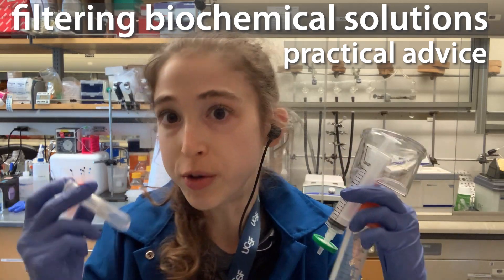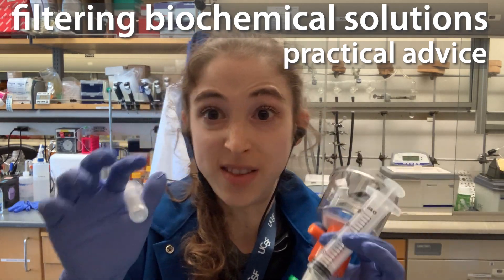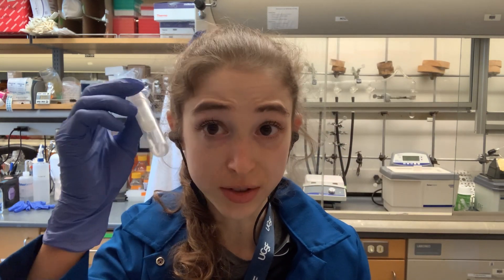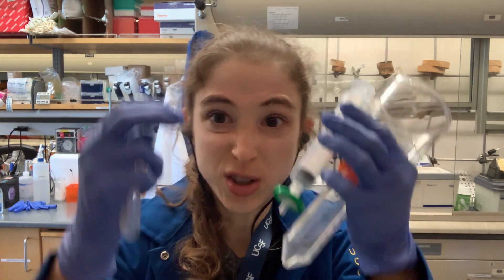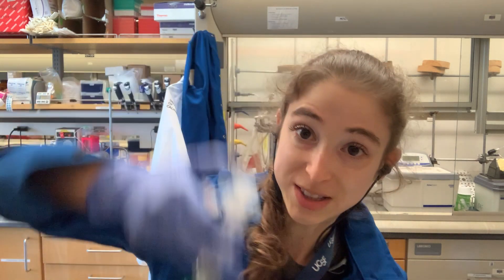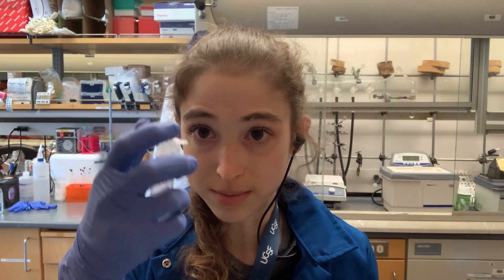There are a lot of times in biochemistry when you want to filter a solution — either to get rid of big clumps of stuff or to sterilize it. There are different ways to filter things, including syringe filters, vacuum filters, and centrifugal filters. Basically you just need some way to push things through the filter — physical force, vacuum, or centrifugal force by spinning.